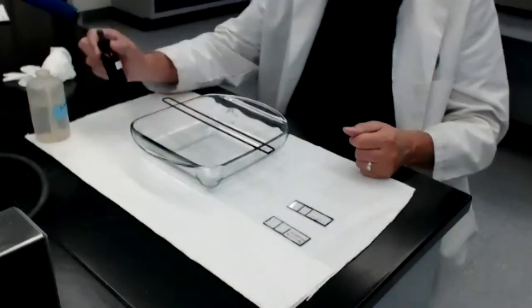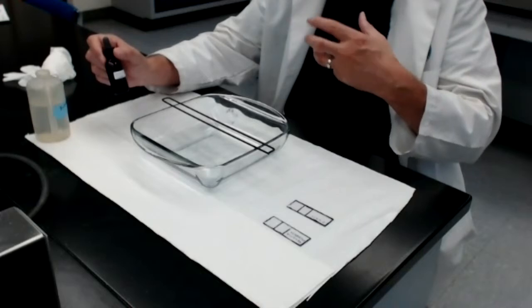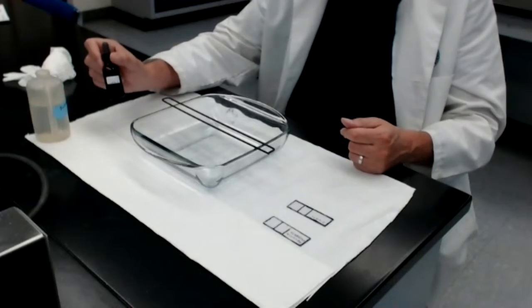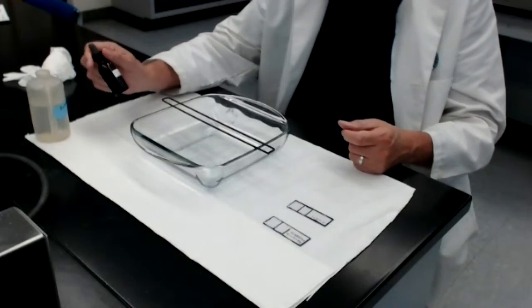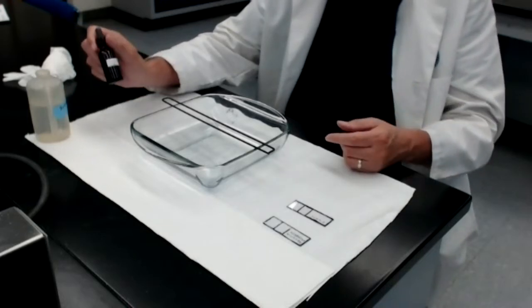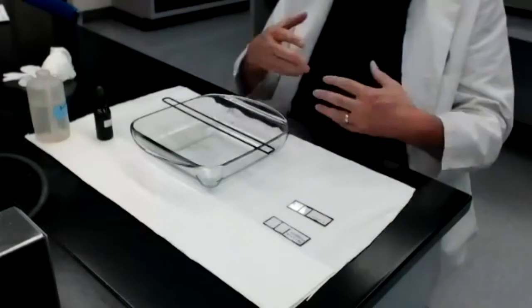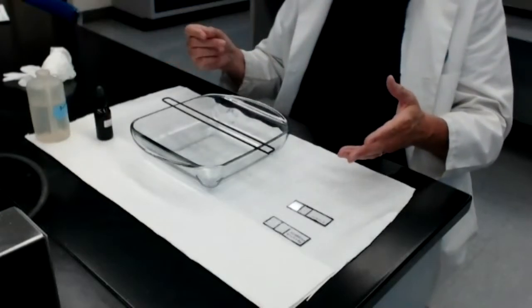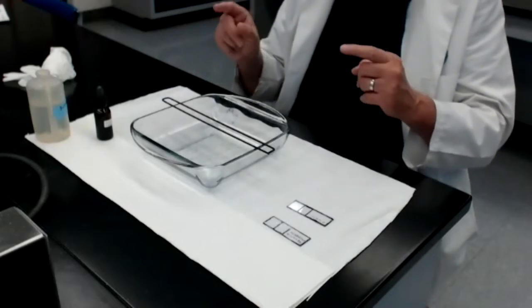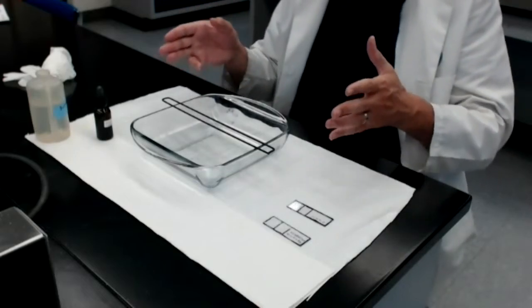Methylene blue, as I mentioned a few minutes ago, is a basic dye, which means the colored part of methylene blue will stick to the bacterial cells themselves. This will give the cells a blue color. Methylene blue will not stick to the glass slide. So after exposing the bacteria to the methylene blue and giving it a chance to stick to the bacterial cells, we then merely have to wash off the excess methylene blue, and all that methylene blue will wash off the slide except for the methylene blue that is sticking to the bacterial cells and making the bacteria blue.